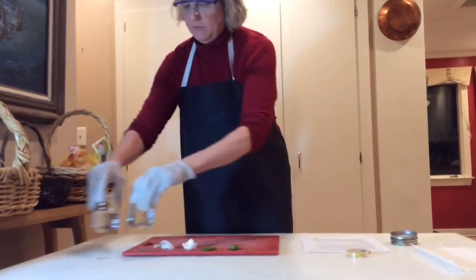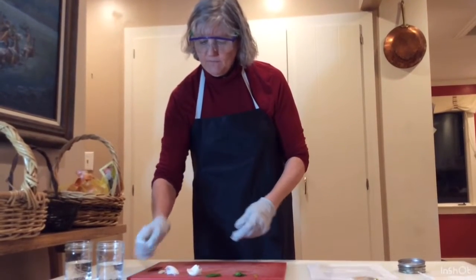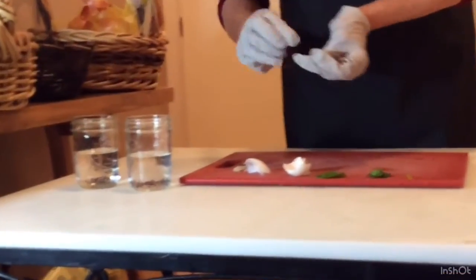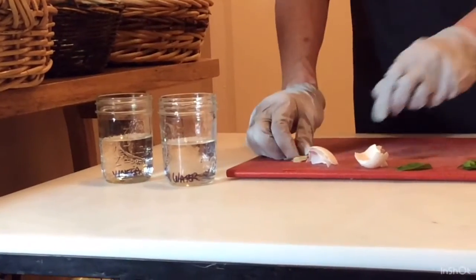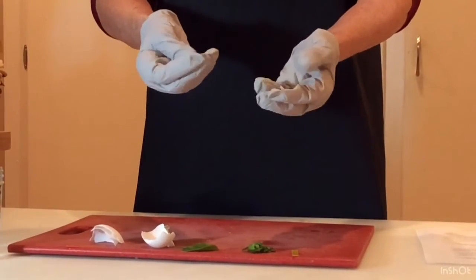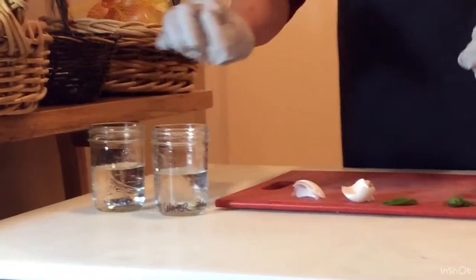Now what we have here, put these aside for a second. I have some items which are going to represent things like buildings and pavements, or non-living things. We have some nails and paper clips. Drop 1 into each. Now, I have a little piece of fossil. That's made of calcium carbonate. You can think of this somewhat like sculpture. Sculptures are made of marble, which is similar. And we're going to see what happens. So put a little bit of that, a little bit of that. So that should be your buildings or your statues.